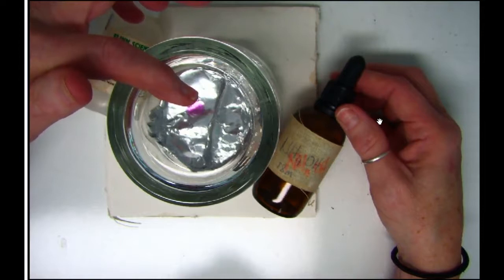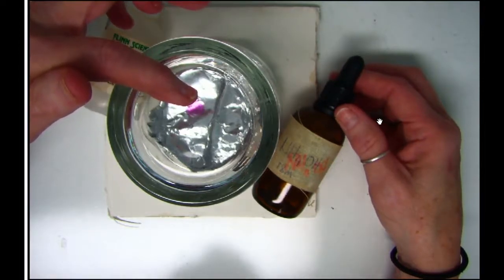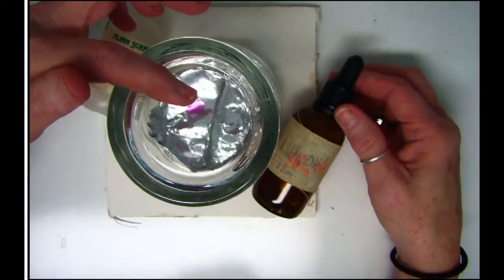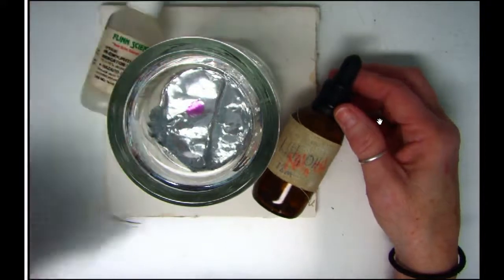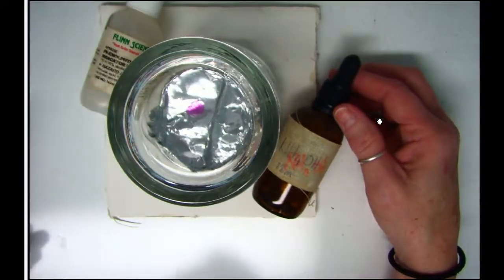The two liquids, they're still separated. The liquids never touched. But the gas, which has the ammonia in it, which is a base, is what is bringing that to pink. So I just wanted to show you two examples. One of them, gases exert pressures, and there's a lab associated with that.